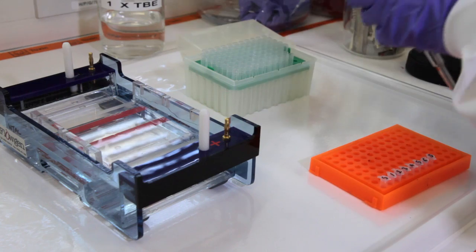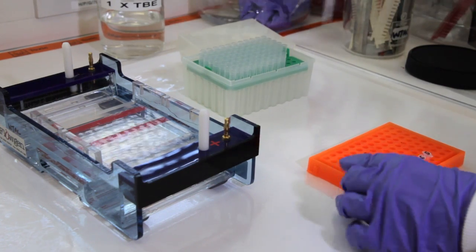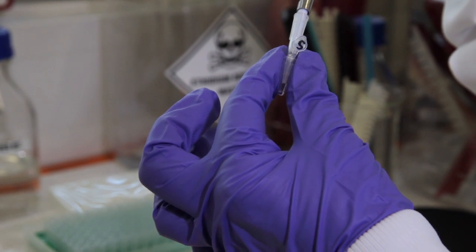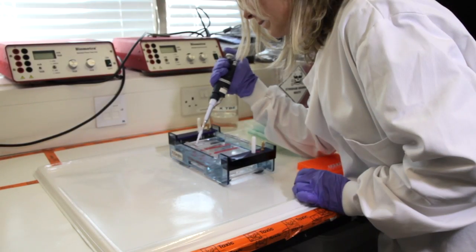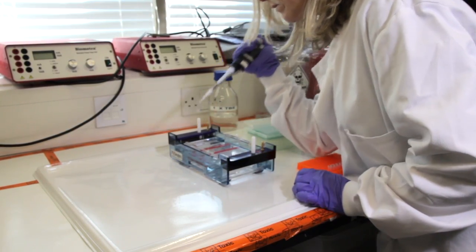To load the gel you will need a loading solution with a dye in it to make the samples heavier when you load them so that they sink into the well. The dye is there to indicate how far the DNA has travelled so you don't lose the samples at the other end of the gel.